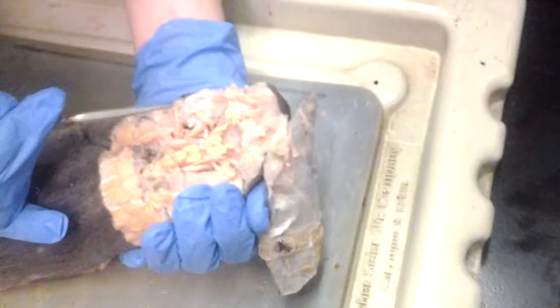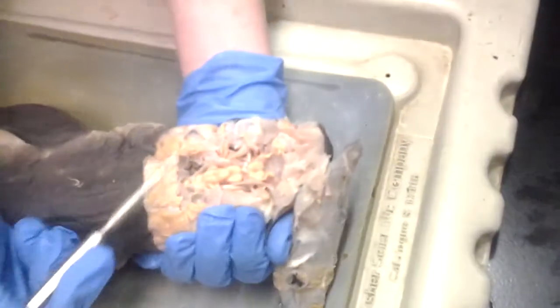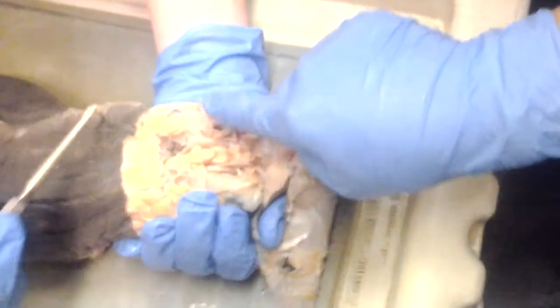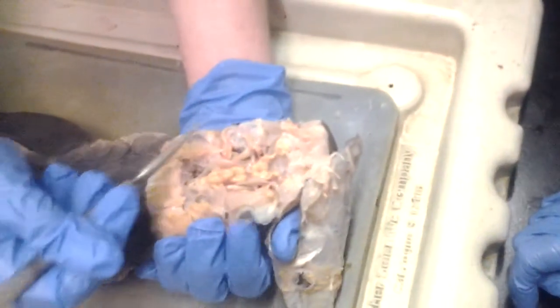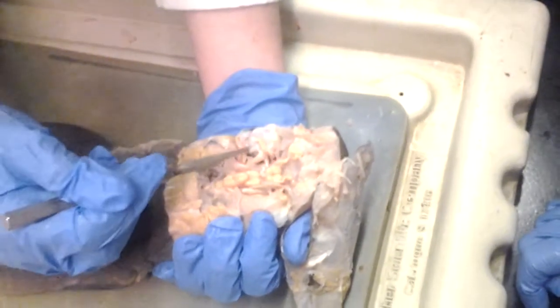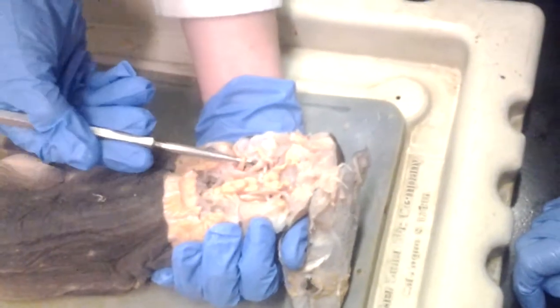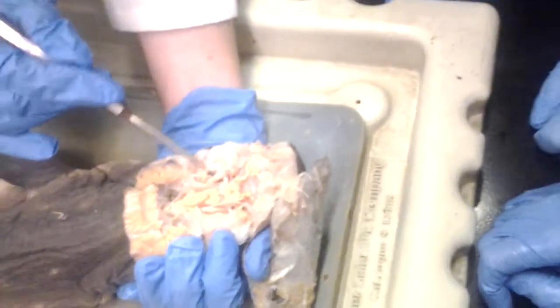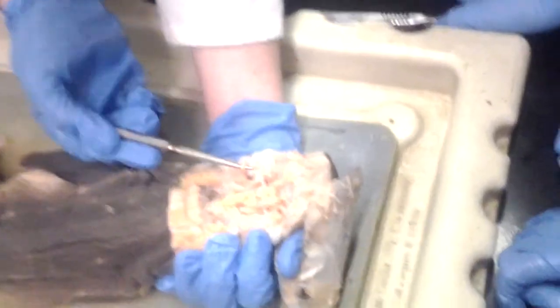It might be, I'm not sure, because it's not facing anywhere. The thing that goes to here would be the superior rectus, right there. Yeah, probably. And that's the inferior one? Actually maybe it's this. So superior oblique, superior rectus. This is probably part of the nerve.